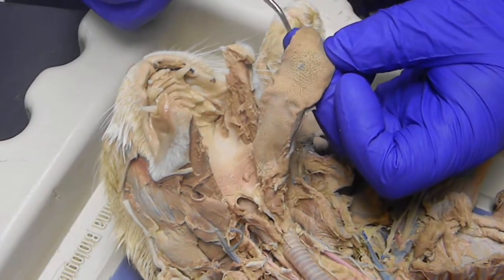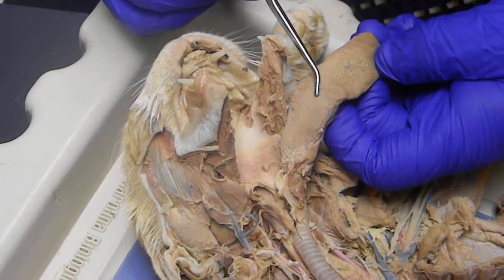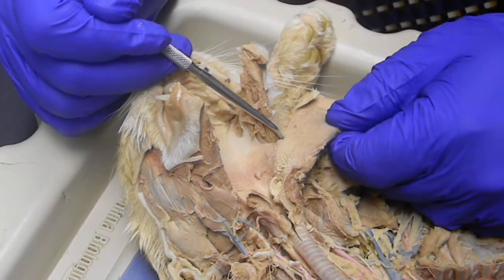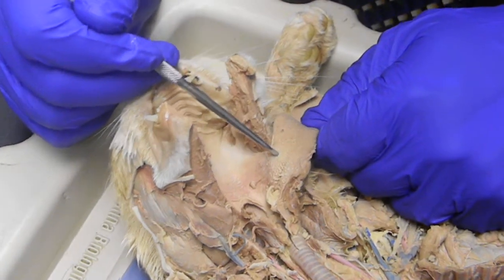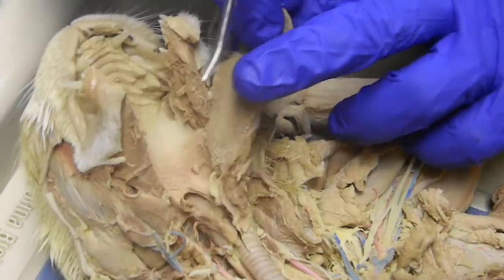All the small round dots that are difficult to see right here, the little tiny ones, are the fungiform papillae. There should be a line of very round ones back here, which this cat's too mature to show, is the vallate papillae. I think he has one right there, but I don't think the camera can pick that up. And then the ones that grow off to the side are the foliate papillae. The tongue is held to the bottom of the mouth by the lingual frenulum, which is this transverse piece of tissue here, right there sticking out.